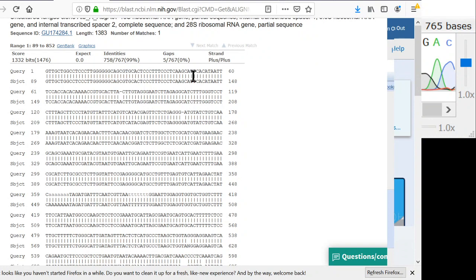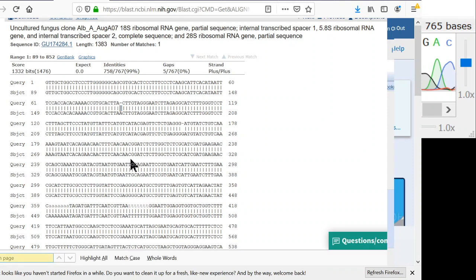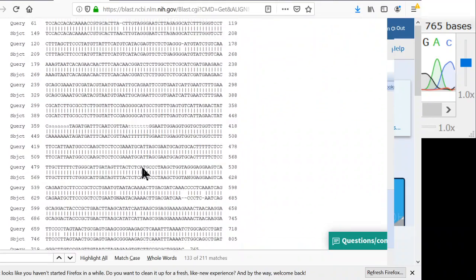And the way this works is there is a pipe character between the top query, that's my sequence, and the subject, which is the sequence we're comparing against. So these characters are called pipes, and there's a pipe character whenever my sequence is the same as the sequence we're comparing against. When the sequence is not the same, the pipe character is missing, and it helps you spot the differences. And a good trick, if you want it to show you all the differences, because sometimes it's hard to spot them just by looking with your eye, is you hit Control F in the web browser and search for pipe space. When you search for pipe space, it's looking for places where you have the space character after the pipe, which means that that's the difference. So here's another difference here. But this one is 758 out of 767, which is actually relatively different. It's probably a closely related species.